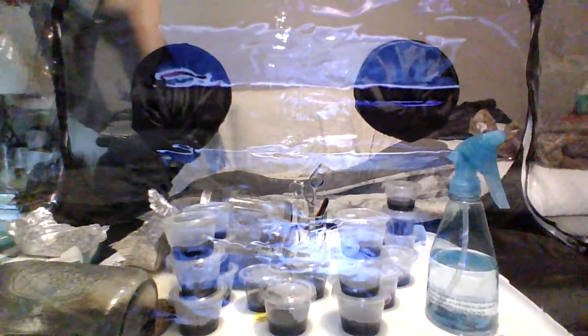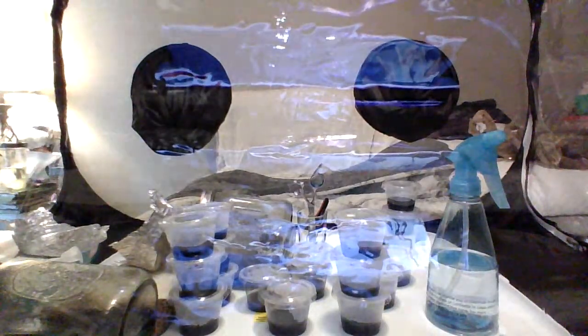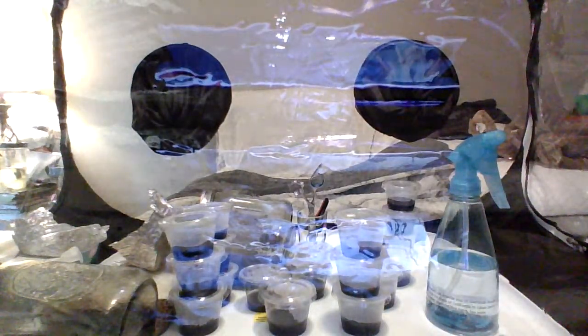You know what? I'm going to turn my lamp light on. I don't know if that's going to give any more light. I'm going to turn my closet light on. Get as much light on this project as we can. There we go.